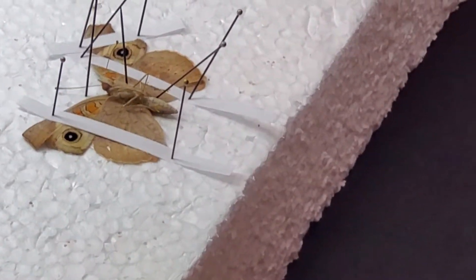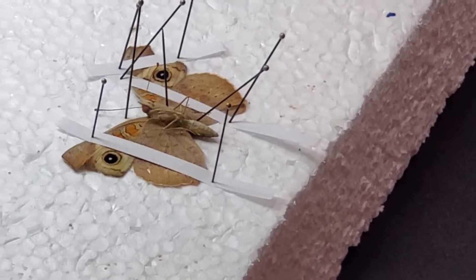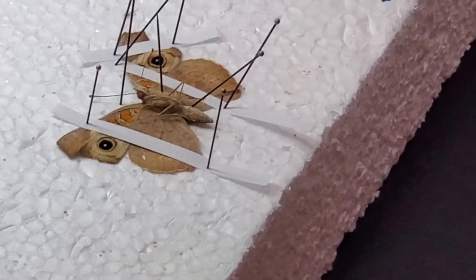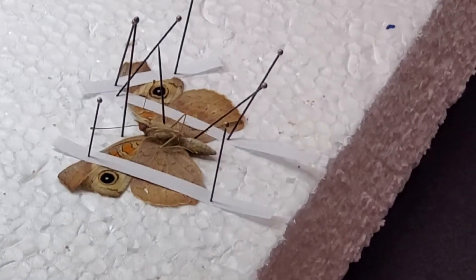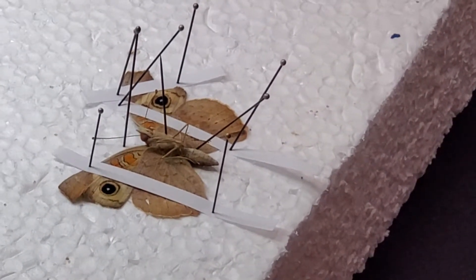Depends what you're doing. If you're making a collection for this kind of class, it's not really an entomology class, you use three or four pins. The bug didn't turn out perfect, it'll be just fine.